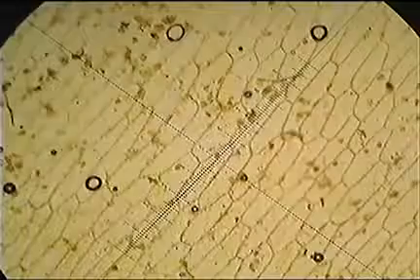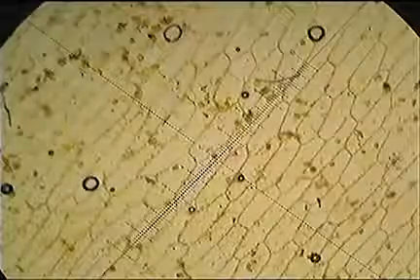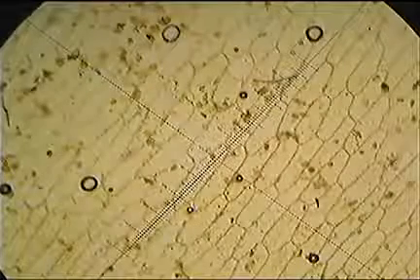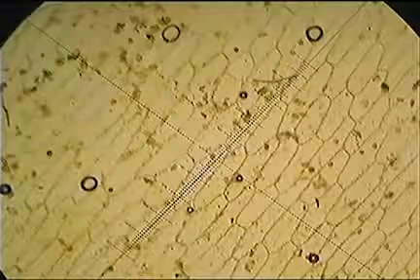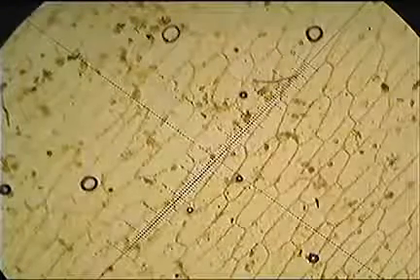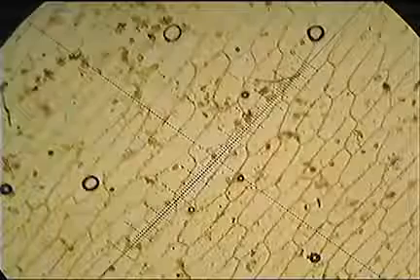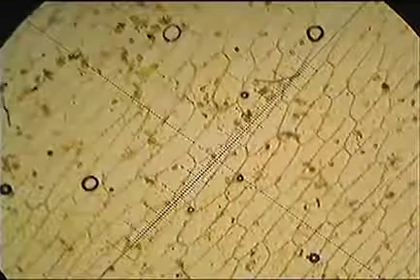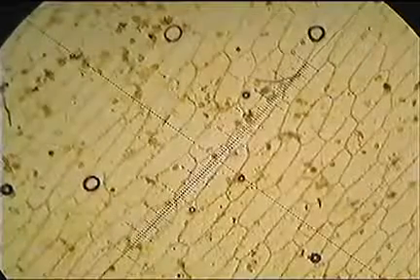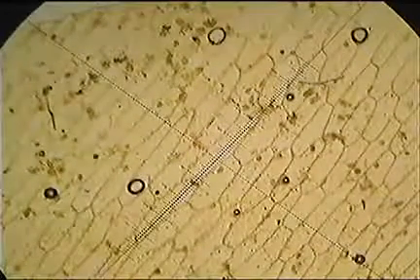So we're going to line up our cell. I've lined one up, looking at the cell just in the middle underneath the scale. You'll notice that rather than rotating the slide, it's actually much easier just to rotate the eyepiece. So I've just rotated that scale so it's sitting diagonally. So lining up the cell in the middle there, from the 3 to the 4, 5, 6, so that's 1, 2, 3 eyepiece graticule units, and it's pretty much exactly 3. Yep, exactly 3. So we would just take 3 times 0.099. So that is rounded up, basically 0.30 millimeters across.